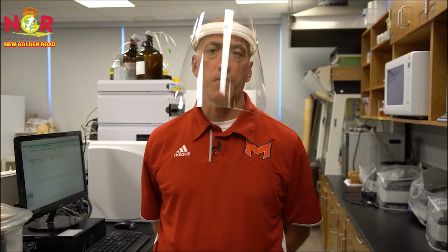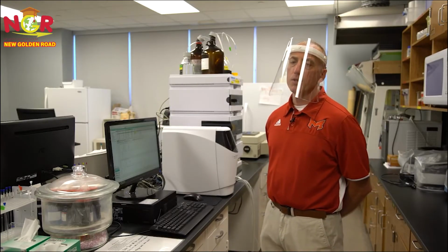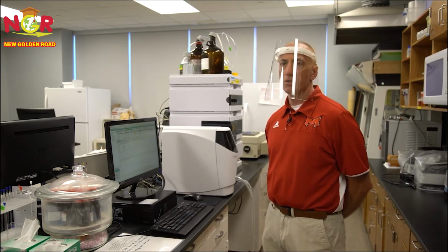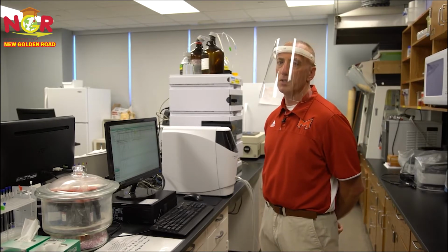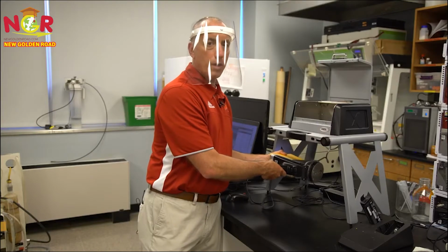Hi, I'm Tom Spudich. I'm a professor of chemistry here at Maryville, and today what I plan on doing is talking a little bit about instrumentation that we have in the lab. So here we have a liquid chromatograph, and we typically use this in our organic classes as well as our instrumental analysis class, and in the instrumental analysis class in particular, you can use this to analyze for caffeine in different soft drinks.